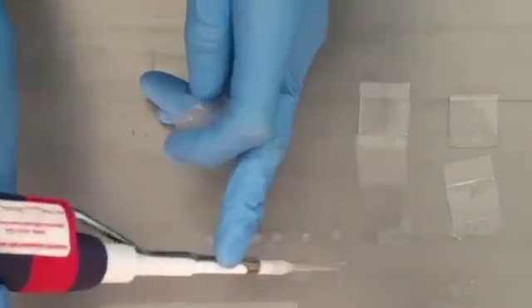To seed the pads with bacteria, pipet a small amount of diluted bacteria onto the small pads. Try to avoid marring the surface of the pads with the tip, which can decrease imaging quality.